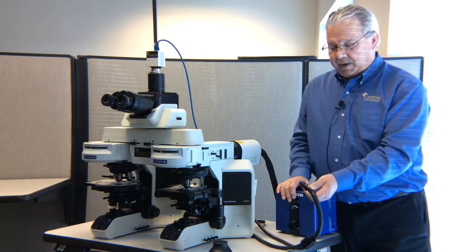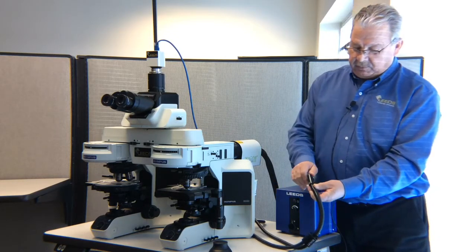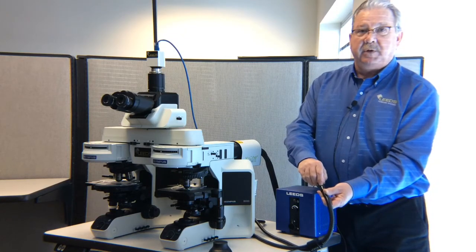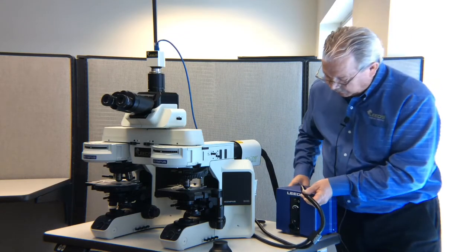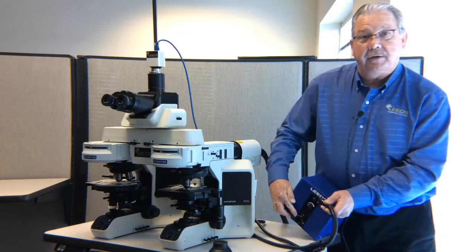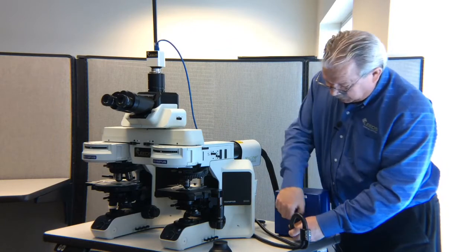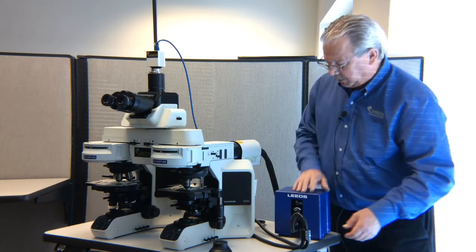To start with, some of our fiber optic cables have a rotary orientation to them. So to achieve proper intensity balance, you want to take a look at your fiber optic cable. If you've got an alignment mark like this, you want to look for the corresponding alignment mark on your fiber optic light source and put those two so that they're in line with one another.